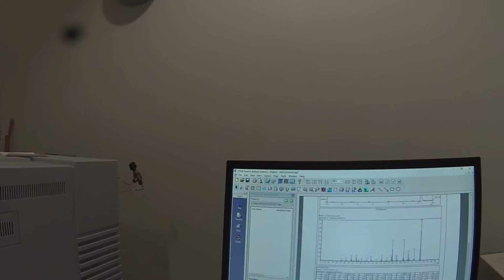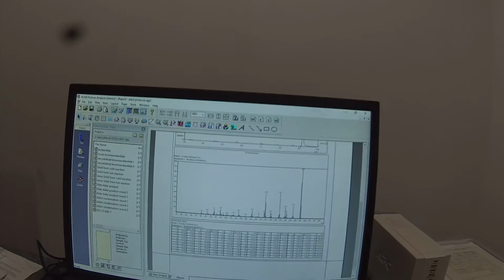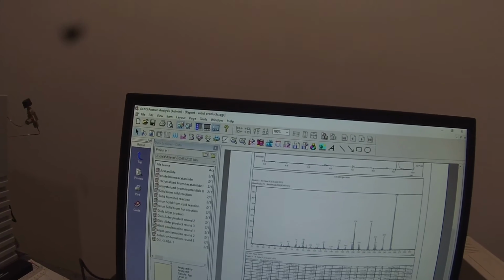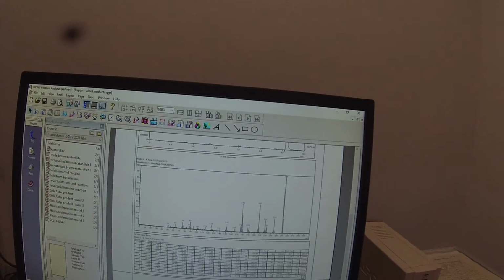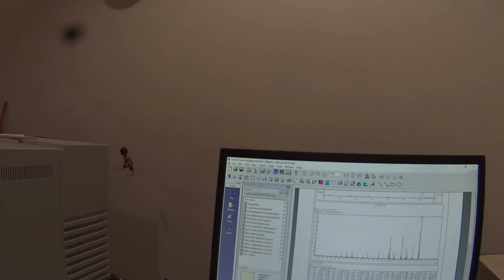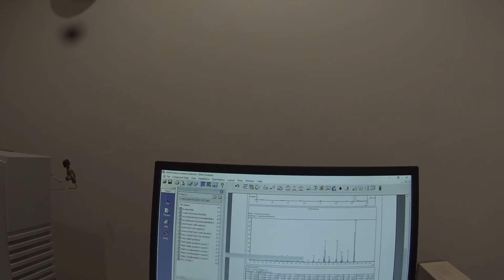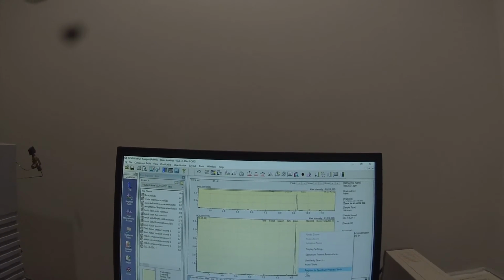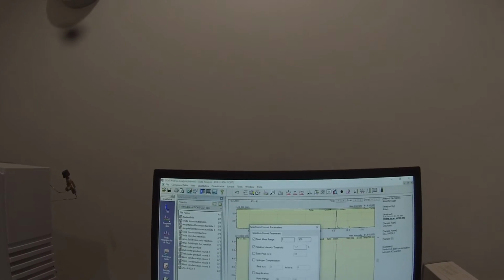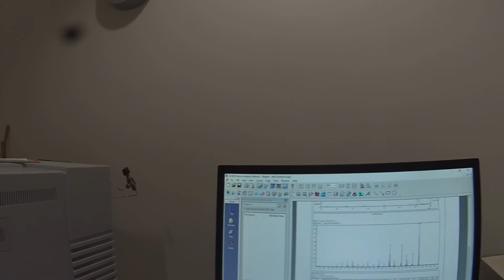And I'm going to go back to the report, and I'm going to drag that file in again. And it should have made some of those peaks go away. We've still got a lot of peaks with relative intensities that are quite low and probably not interesting, and we only have, you know, up to 223 here. So I'm going to go back, and I'm going to actually set that again, right click, spectrum format parameters. I'm going to tell it, let's try 1.7. We'll OK that, save the data file, and we'll go back to the report and we'll drag that in again.